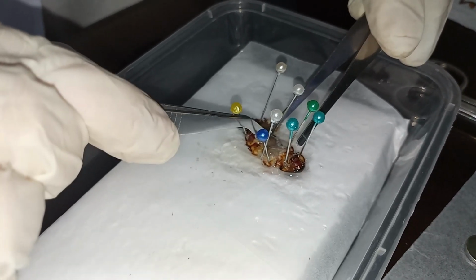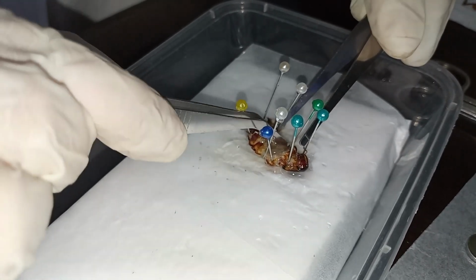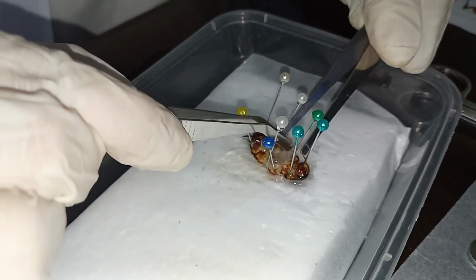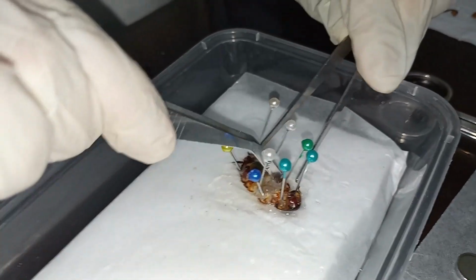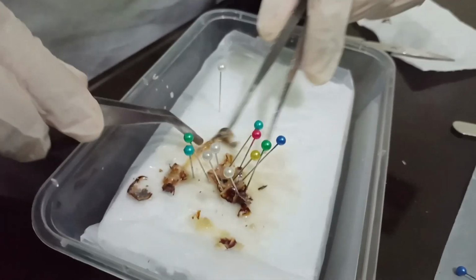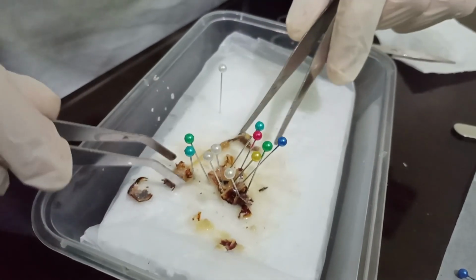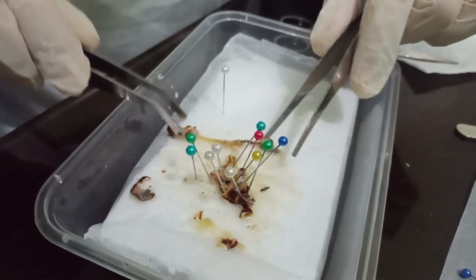These white particles are removed using forceps until the digestive part of the cockroach is visible to isolate. The white particles were easily removed by putting clear water on the specimen, which softens the fats for easier removal. The isolation started in the posterior part of the cockroach, from the rectum up to its endmost anterior part, the mouth.